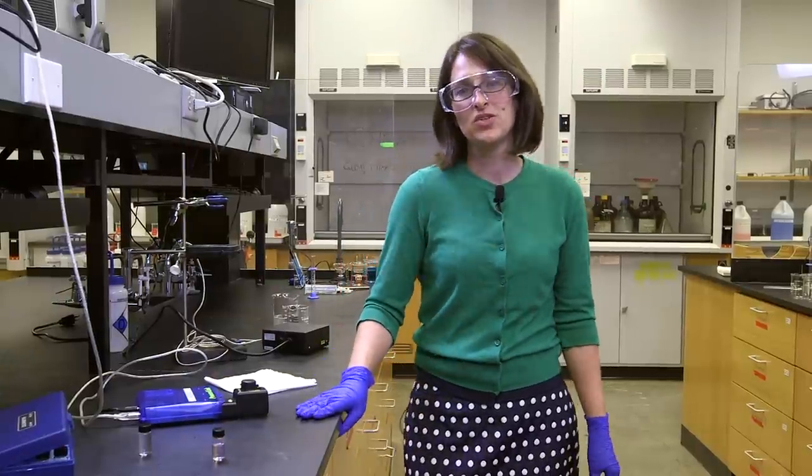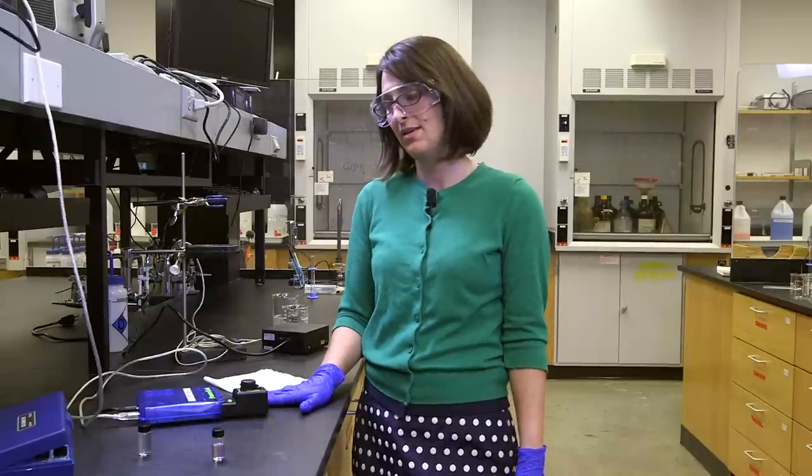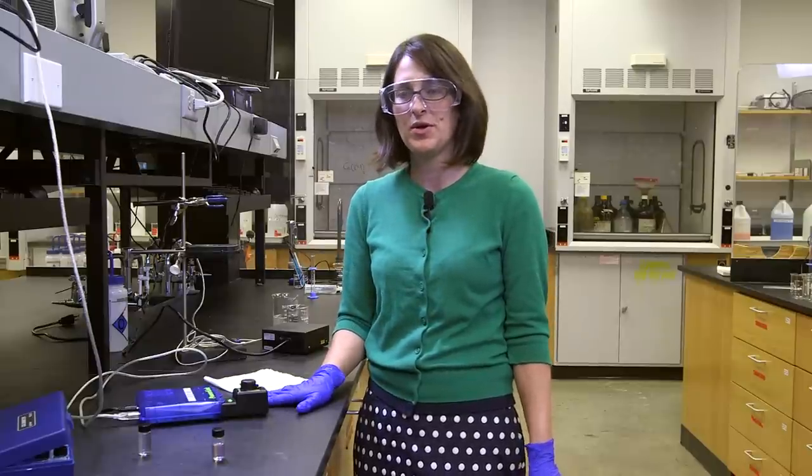In a few of our experiments, we're going to measure concentration using a colorimeter, which is like a basic form of a spectrometer.